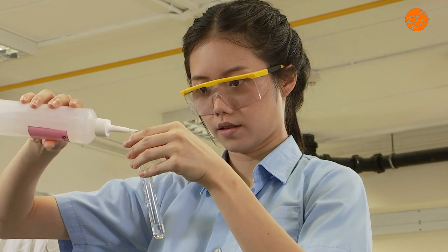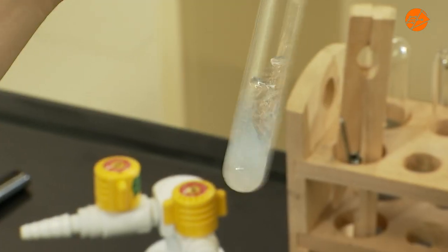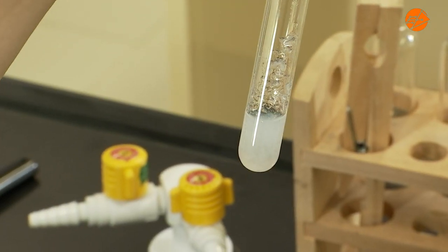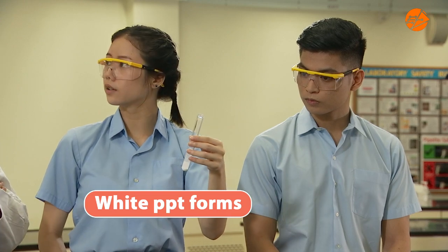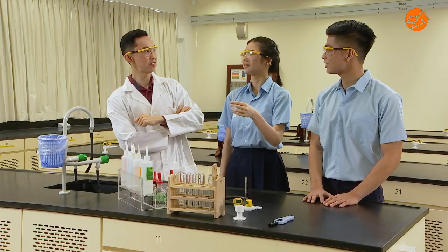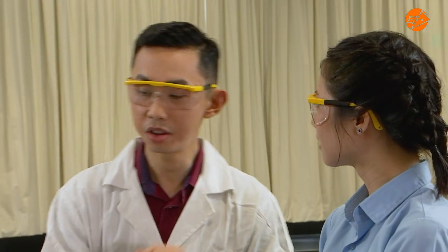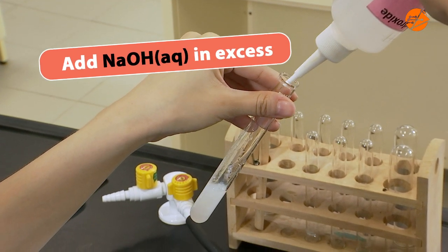Drop by drop. What do you observe? I see white precipitate forming. But white precipitate at this point could mean a couple of different cations, right? Yes. It could mean zinc, lead(II), or calcium cations. Very good, Adam.